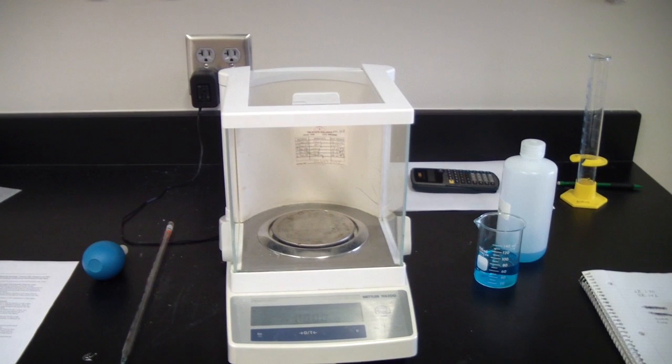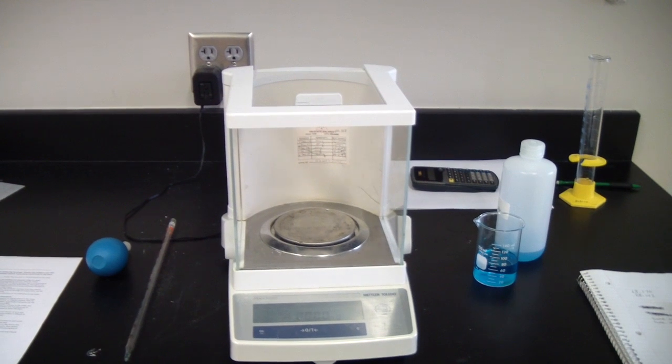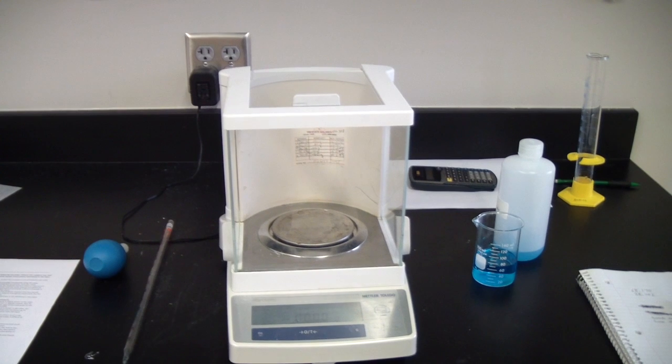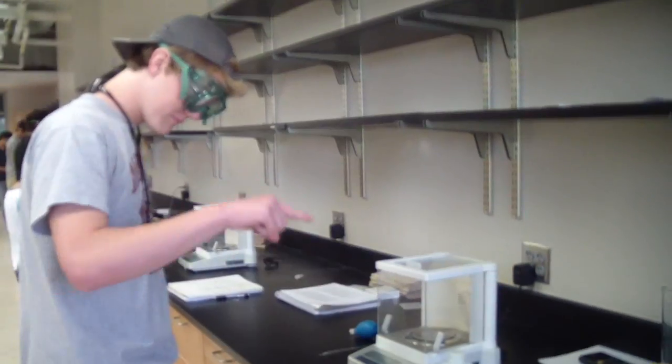Also, when doing any experiment, it's very important to use the same balance throughout the entire experiment, because if you use different balances, one may be more sensitive, another less sensitive, and they can cause differences in your information that could throw it off and make it significantly incorrect.